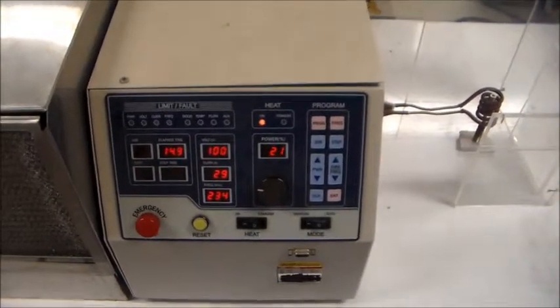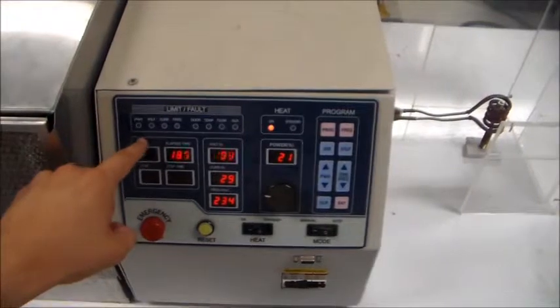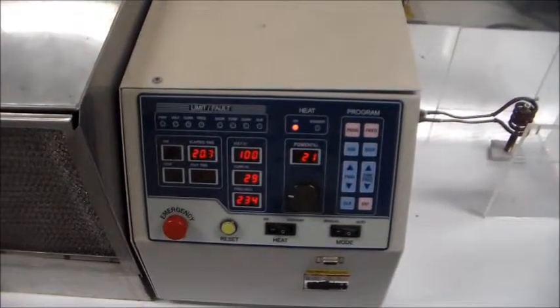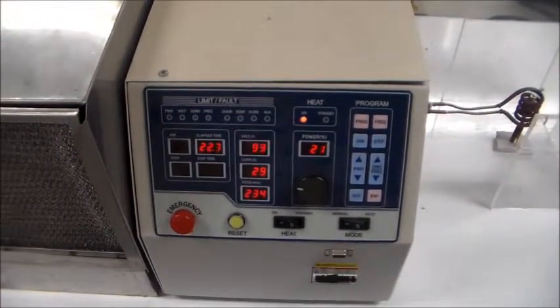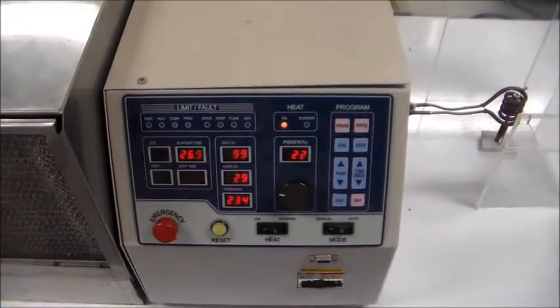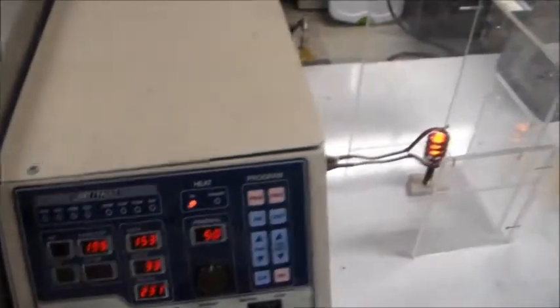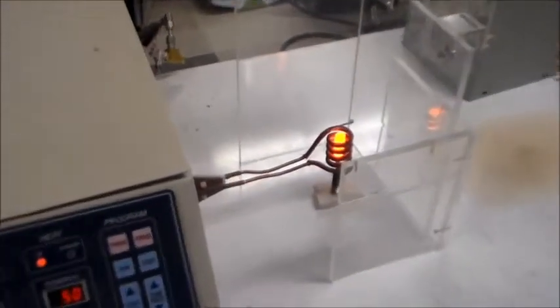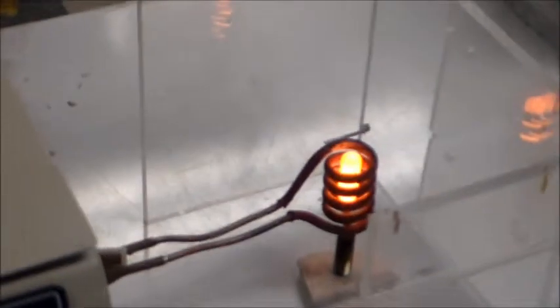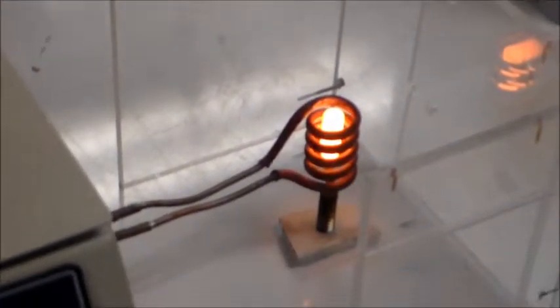Now, it is important to check that these light indicators are not turned on because if one of them is turned on that means that the system is running unstable and you need to immediately shut it down. Notice how the material sample is gaining heat, so be careful of not touching any heat component.